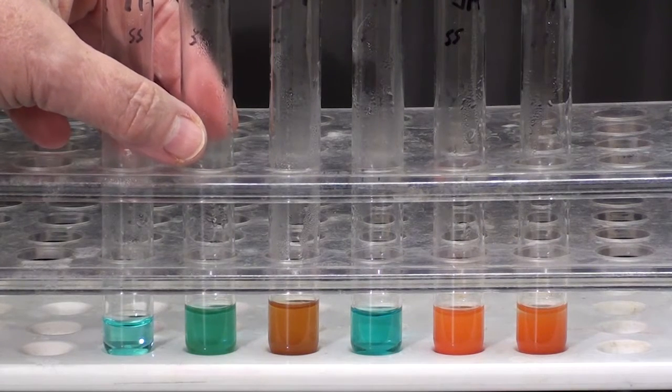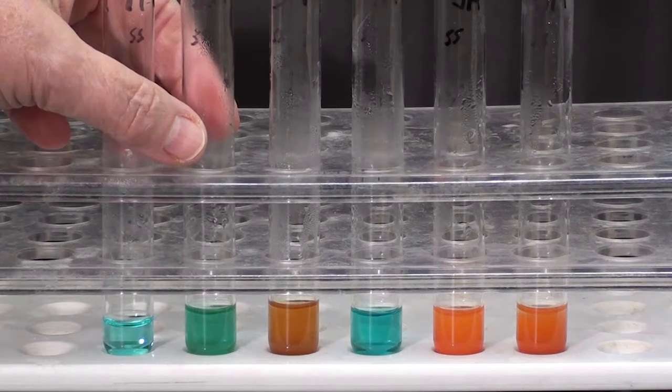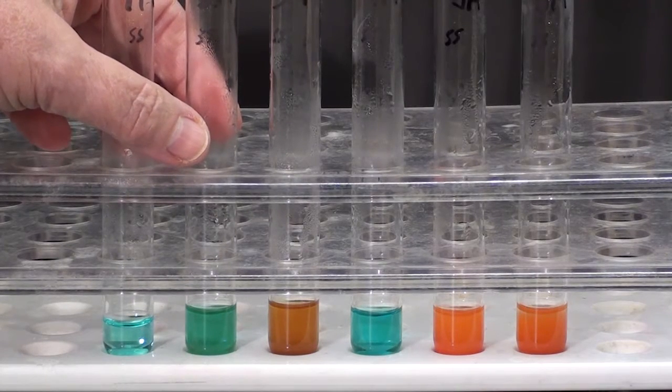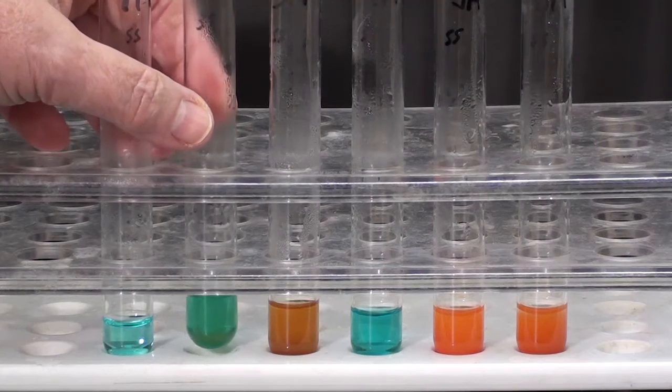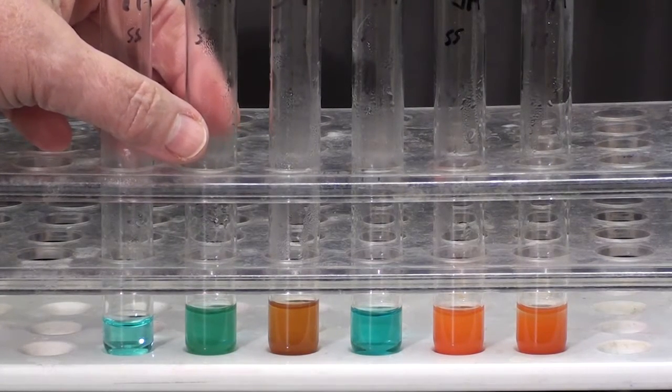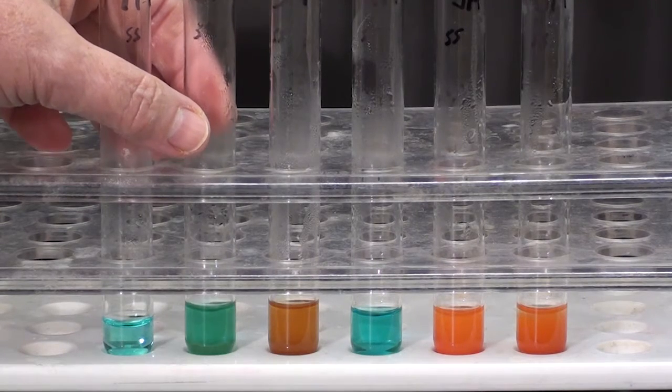And under closer inspection, there are small red particles precipitate in this solution, indicating some reaction. So starch began to digest. The Benedict's discovered a very small amount of sugar in tube two.